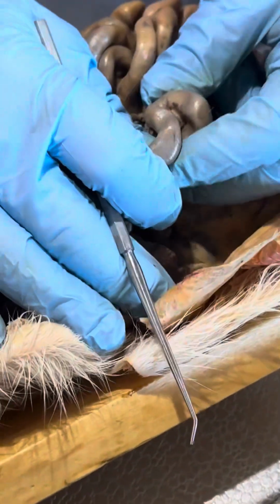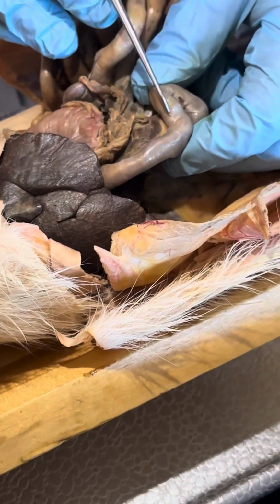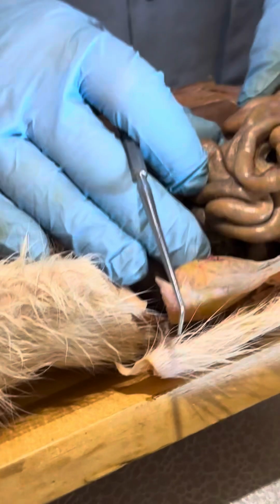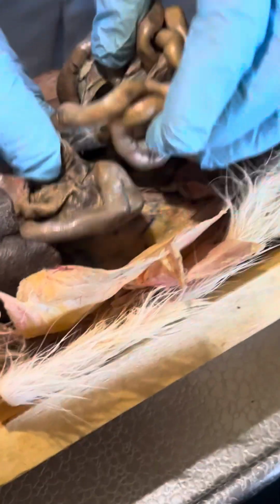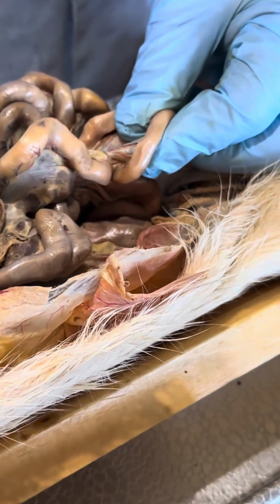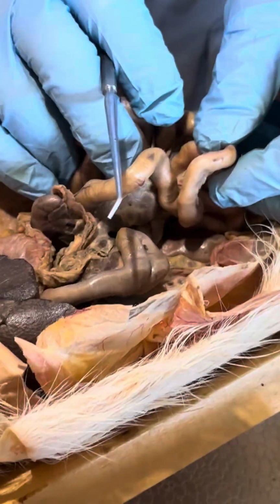And where the duodenum ends, usually this one's kind of kinky, so probably this cat's belong to Sexy Red. But normally this just kind of reflects and goes into the jejunum. This is like an extra curve here. So almost all of this is jejunum, okay? And then if you go to the colon, the last 4 or 5 inches, about that much between my thumbs, that's the ileum. So is it I-L-I-U-M or I-L-E-U-M? I-L-E-U-M, oh my God.